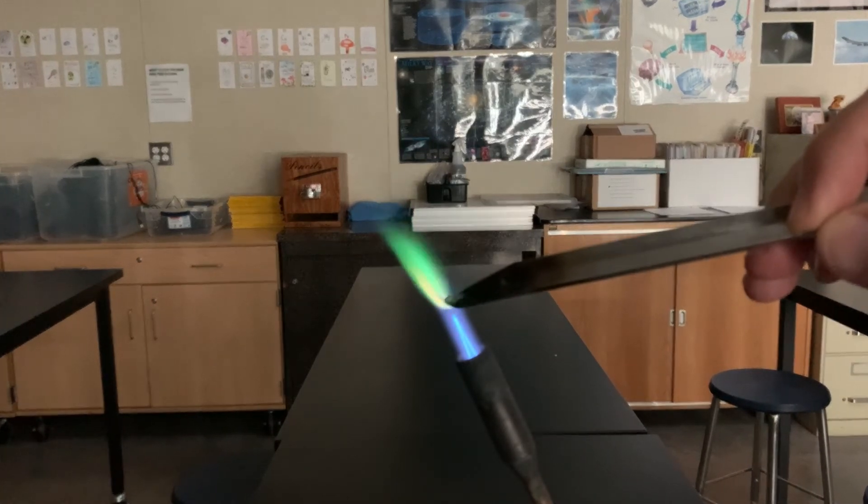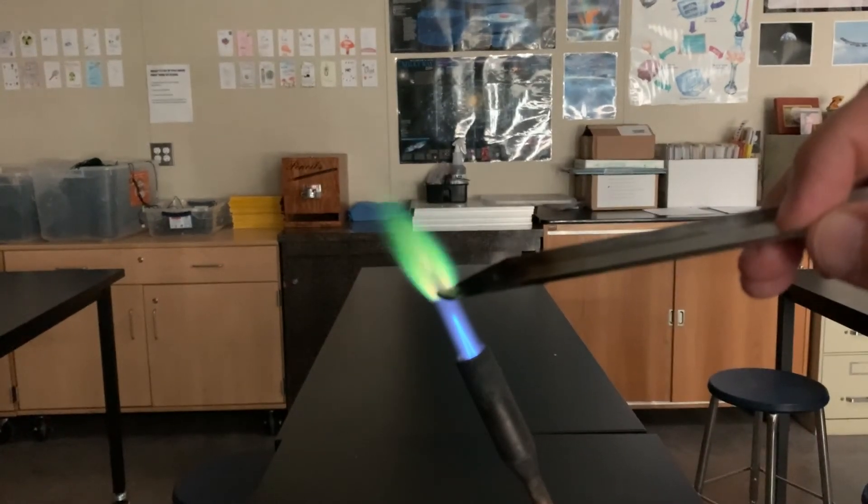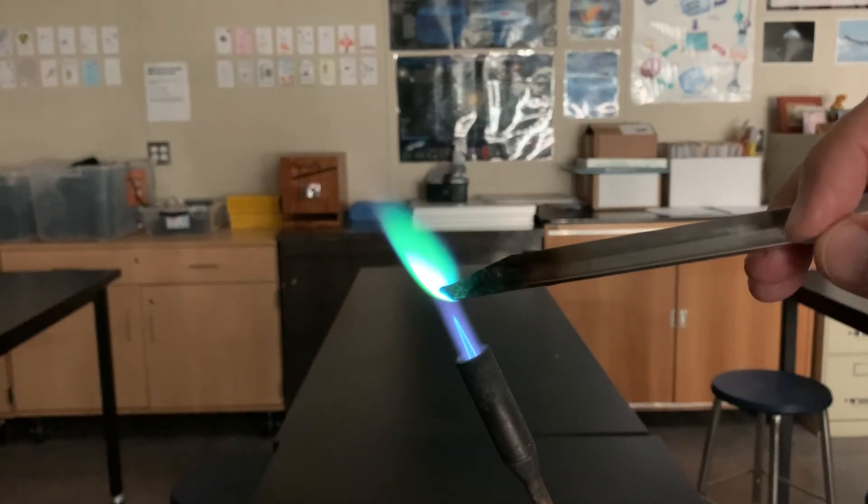This one makes a beautiful bluish-yellowish green. Right there.